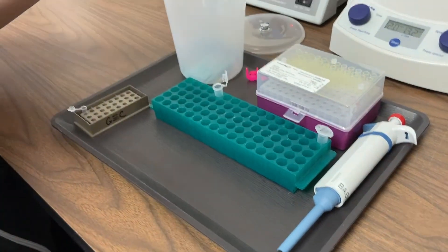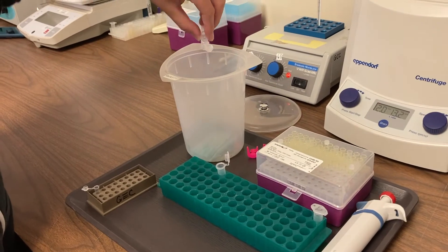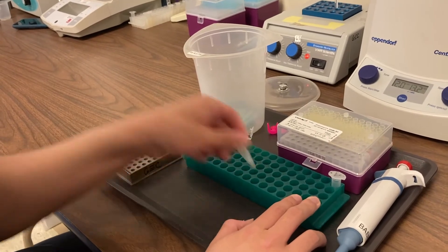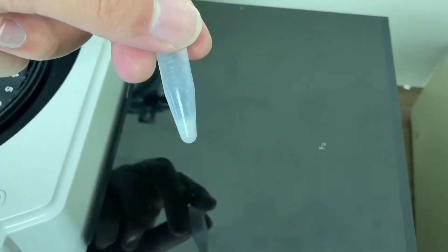What you're going to do next is pour off what's called the supernatant — the liquid that's on top of those cells. We don't need that anymore; that's just saline. We have about 50 microliters left on top of your cheek cells, and we're going to rack those cells to mix them up really well in the remaining bit of saline.